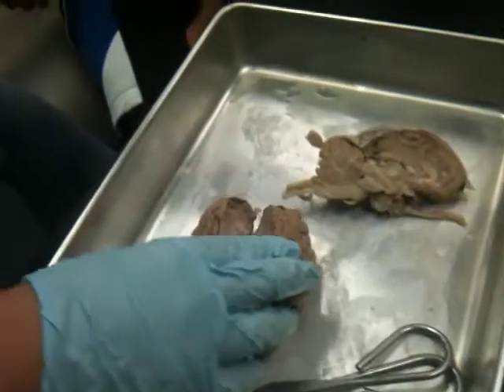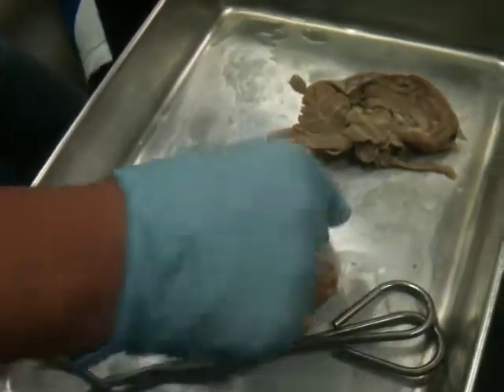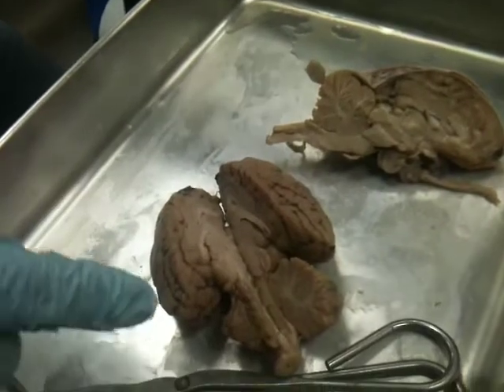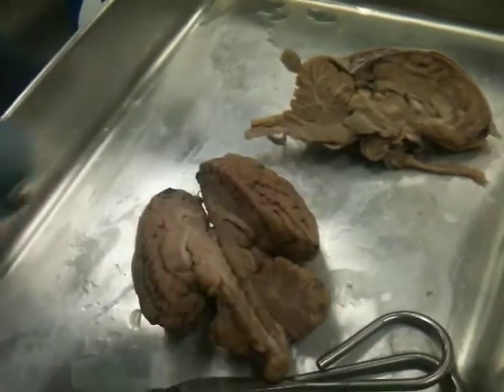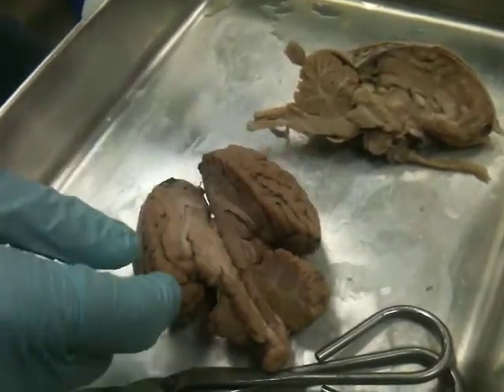So you have the different lobes, and then in this outside layer that has the lobes and these little valleys running through it is the cerebral cortex. And these valleys have a name, they're sulci, and then the area between them, or the hills, are called gyri. Okay? And that's the gray matter?